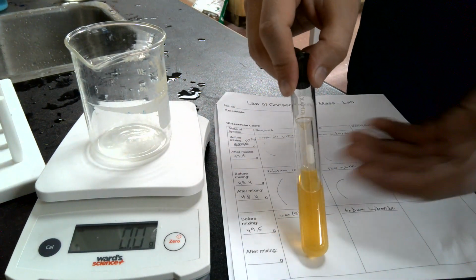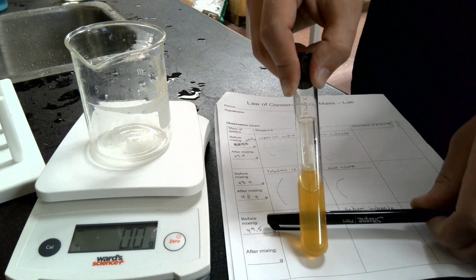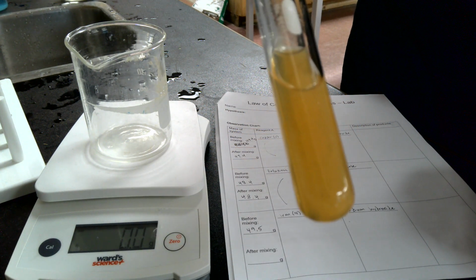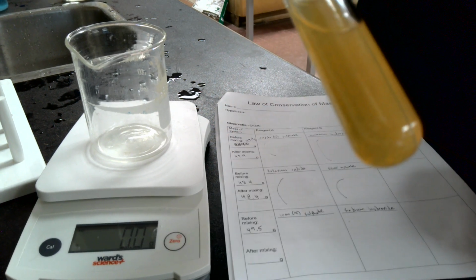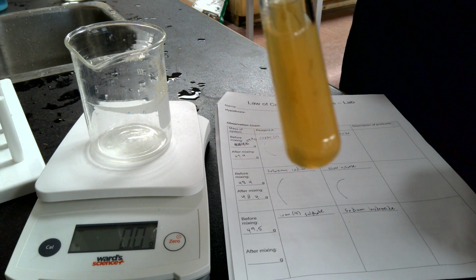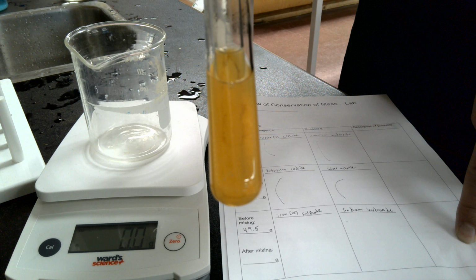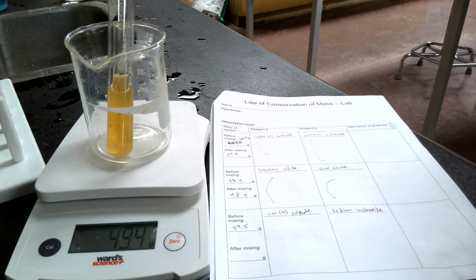So you take your observations of that liquid to give you an idea of how see-through it is. So it has gone kind of cloudy. The longer you leave it, the more, I guess, chunky it goes. So you should be reporting your observations of this solution in this last column of your chart. Okay. We should also weigh it again.